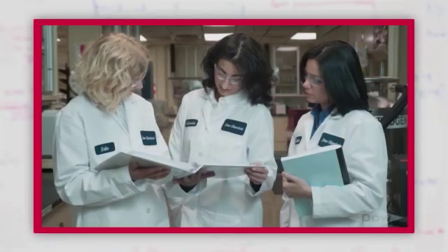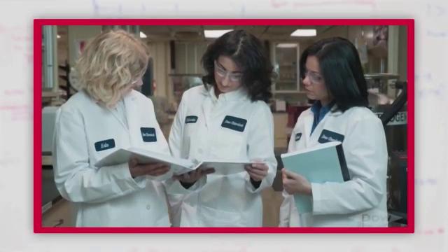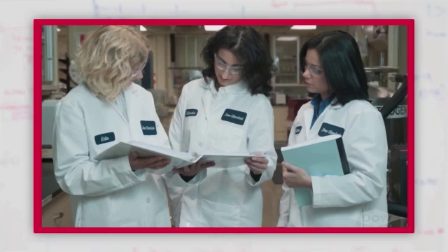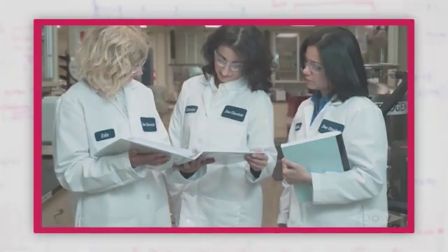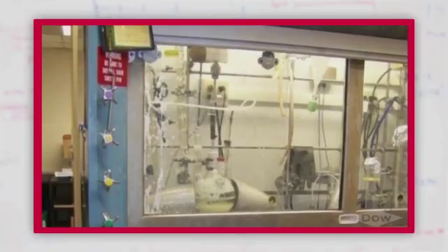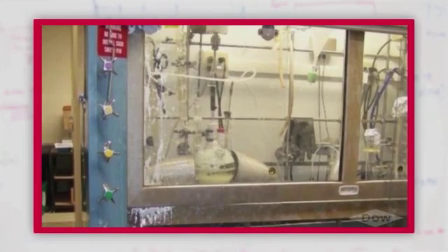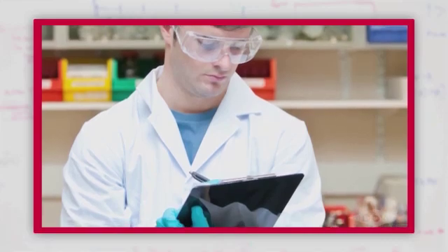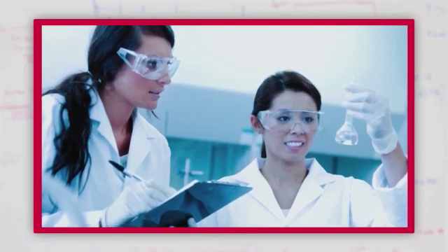Like Amaruka and Trevor, you will want to create a formal or informal report about inspection findings. What form your report takes will depend on your lab's procedure and the nature of the inspection. Another component of inspections is the use of follow-up tools for any discrepancies that are noted, depending on the severity of the discrepancy. Trevor and Amaruka are using an action item list, but there are other tools available, including a learning experience report. Taking a digital photo to share with the work group as a safety moment at an upcoming meeting or through a communication can be very powerful to help others learn to recognize and mitigate potential hazards.